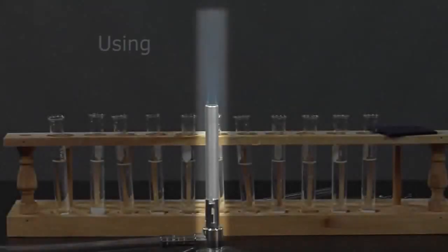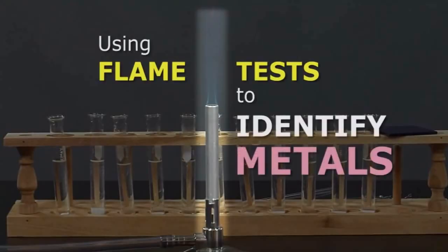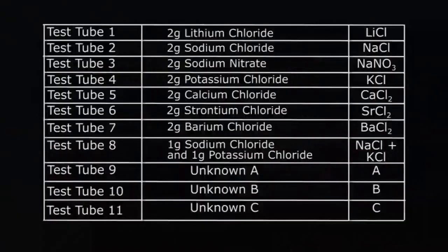In this experiment, we will use flame tests to identify various substances. As always, it will be necessary that you have your lab report at hand and that you make sure you record the necessary data. As you watch this lab, refer to this chart found in your manual.